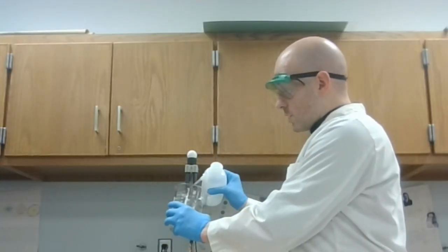Now, that is all 5 tests for all 6 samples. Go ahead and make sure to record these results and answer the conclusion questions on the front of your lab packet.